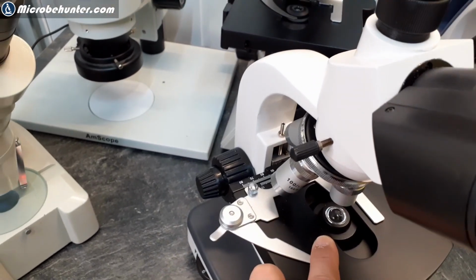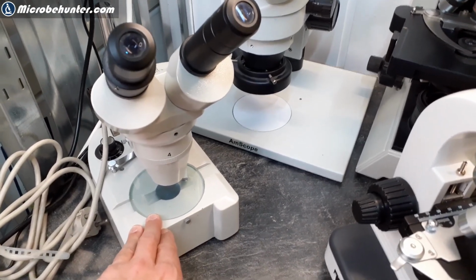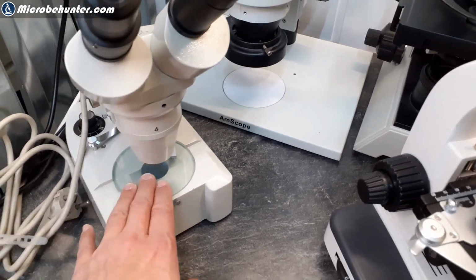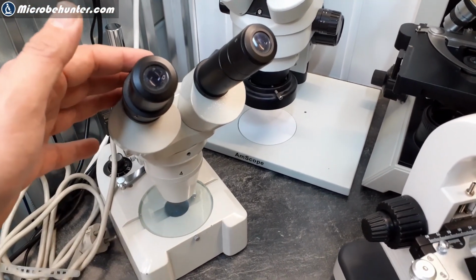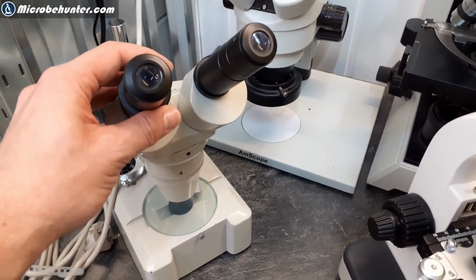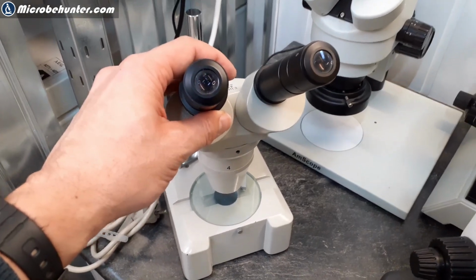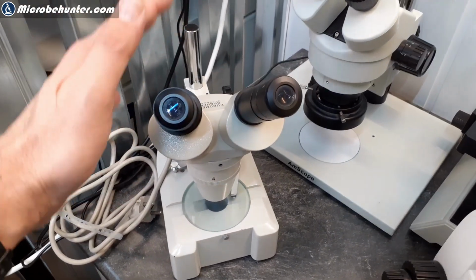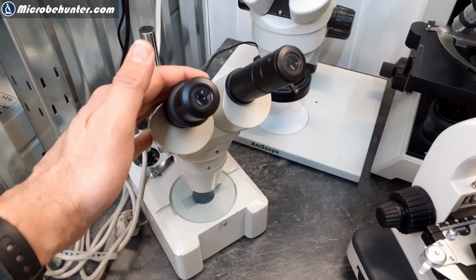For children, if the children are young, I definitely recommend a stereo microscope because you do not need to do any specimen preparation. You find a bug somewhere, you put it under the microscope, you can look at it directly, and it has a very immersive view, and the view is upright. So it's like a very strong magnifying glass. But I still would say that the image is significantly more impressive than looking through a magnifying glass. So for young children, this one is certainly to be recommended because it's also easier to use.